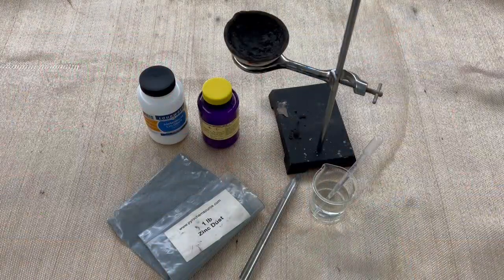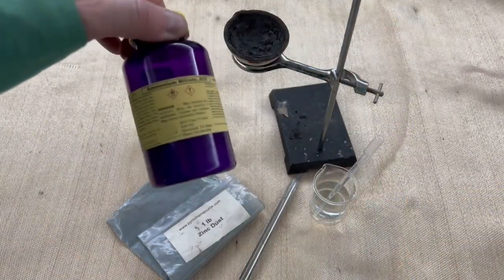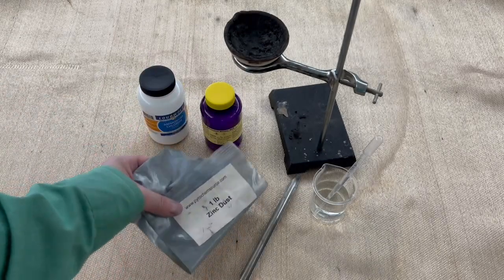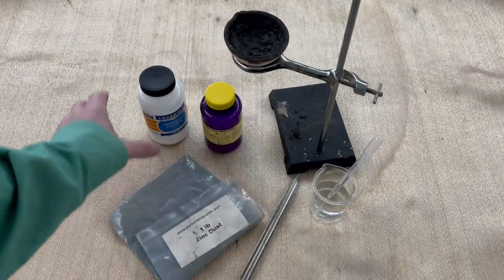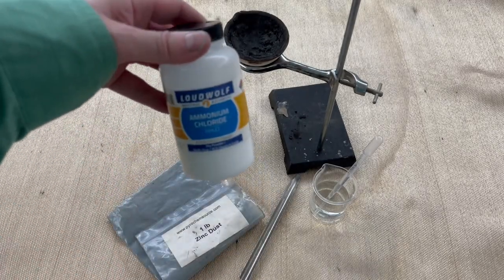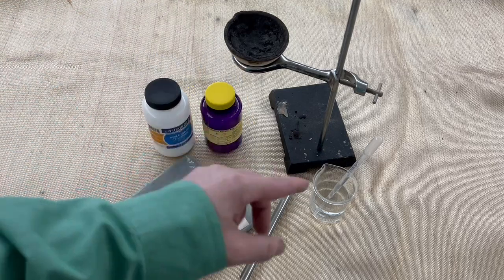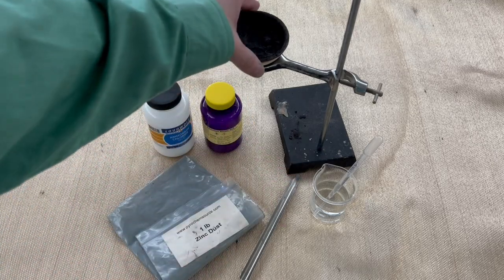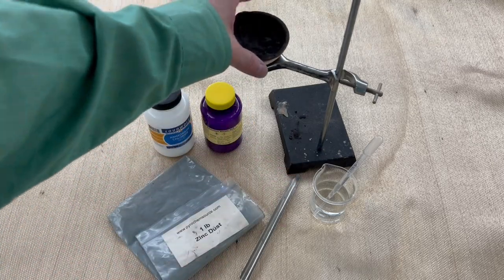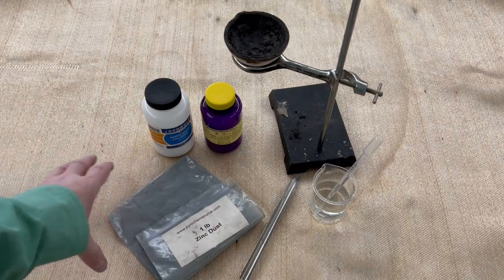For this investigation I'm using ammonium nitrate, fine zinc dust, ammonium chloride as a catalyst, a drop of water, a crucible because this gets really hot on a ring stand, and a welding blanket.